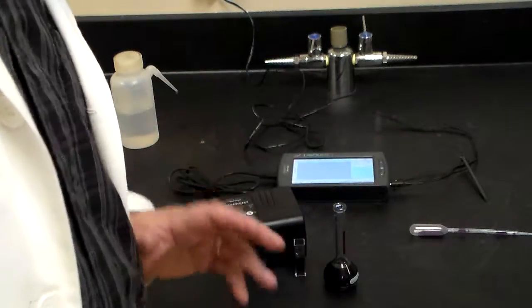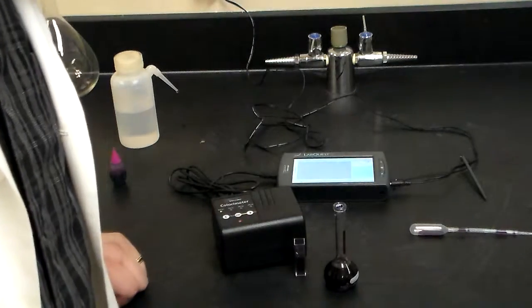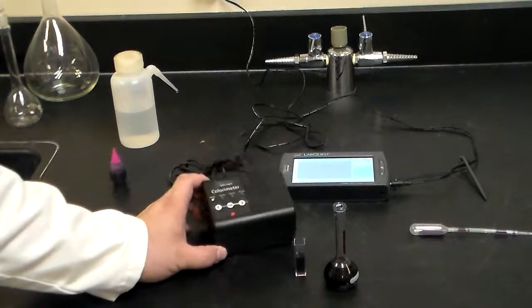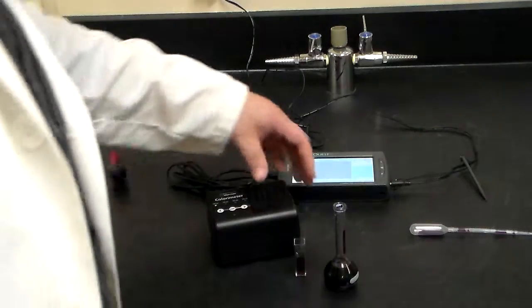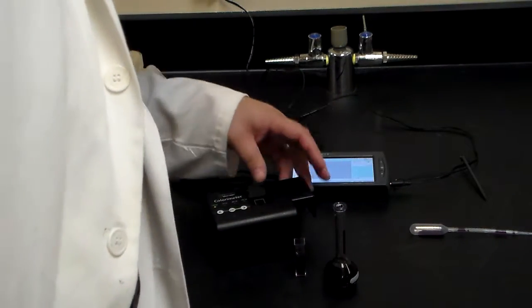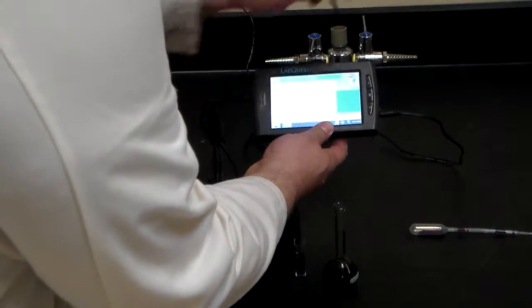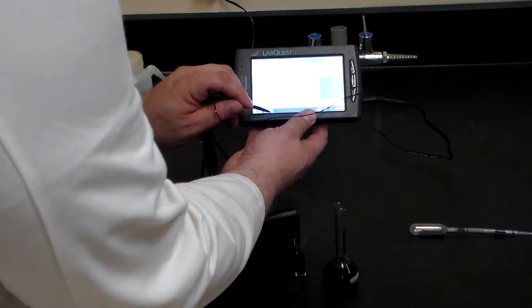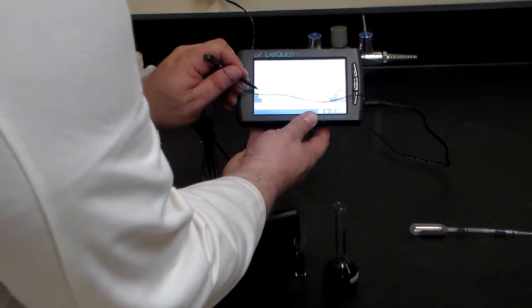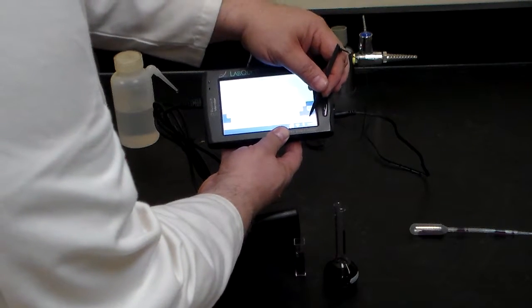Now, in this case, because it's a blank, I'm going to go ahead and calibrate it. So you'll see the red thing flashing. It's stopped. It's calibrated. This is good. Okay, goody. No water has spilled. So what do I do here? On here, you're going to see the little Lost symbol, the Dharma symbol that says keep. So I'm going to press that, and I'm going to call that event 1. It really doesn't matter. I'm going to press OK.